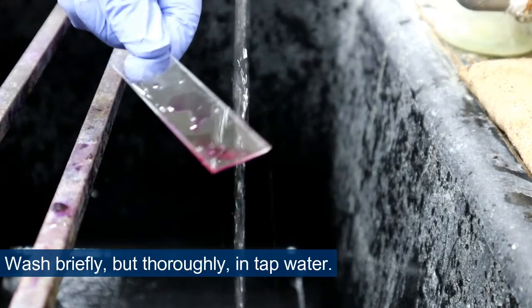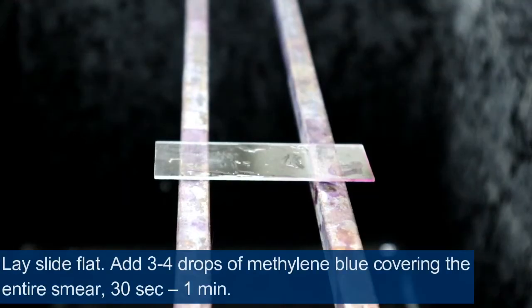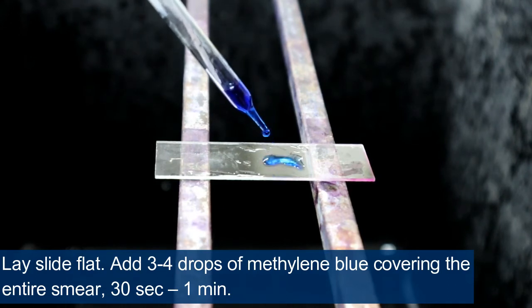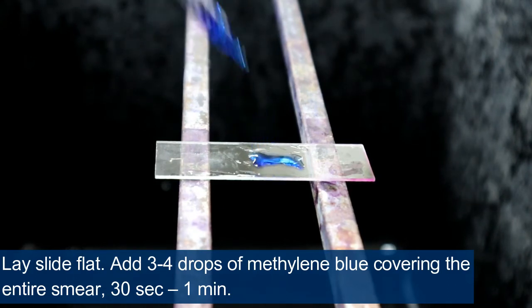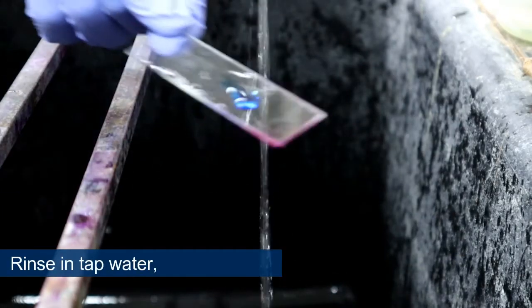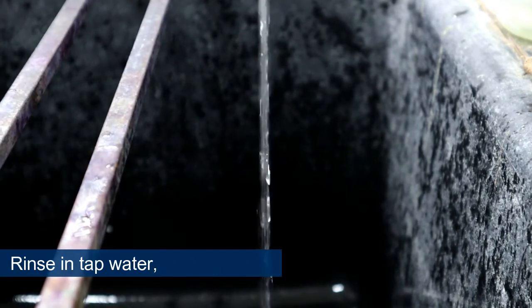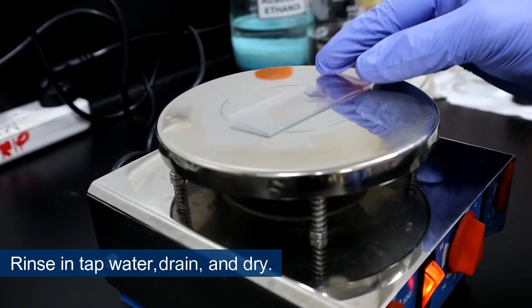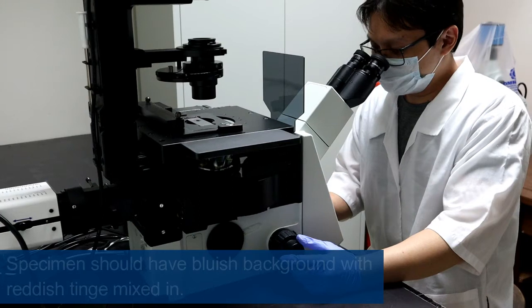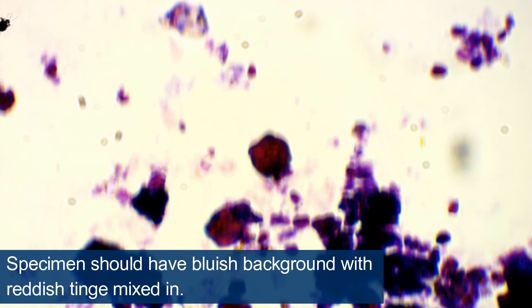Wash briefly but thoroughly in tap water. Lay slide flat. Add 3 to 4 drops of methylene blue covering the entire smear for 30 seconds to 1 minute. Rinse in tap water. Drain and dry.